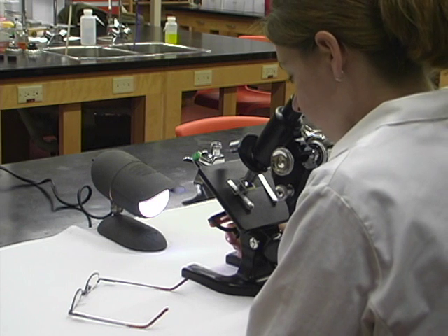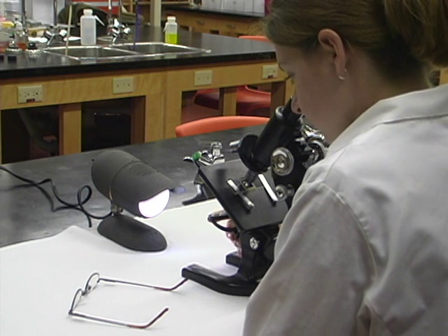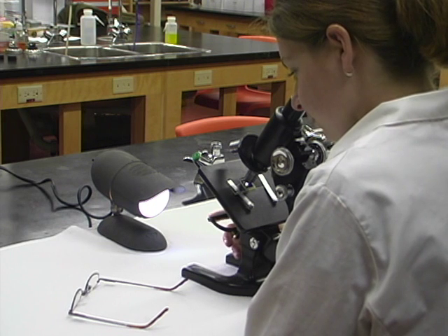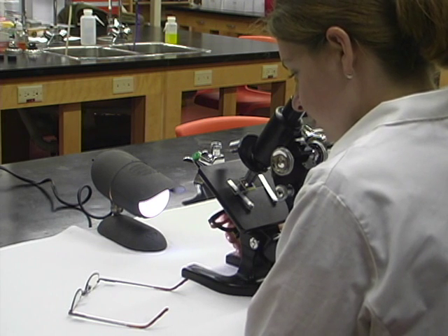In this type of microscope, use the flat side of the mirror if you have a condenser and the concave side if you don't. Angle the mirror to evenly illuminate the field of view.